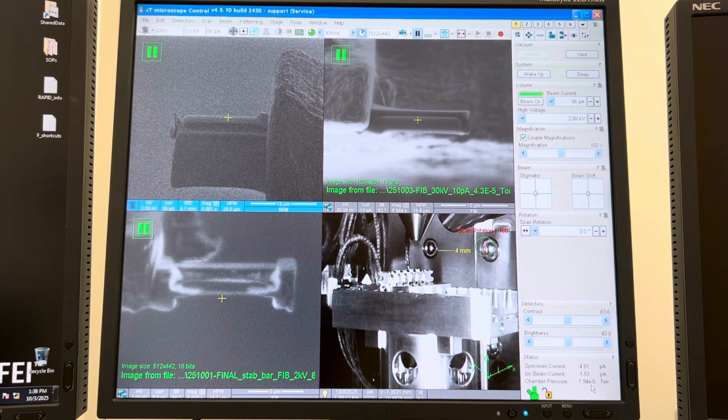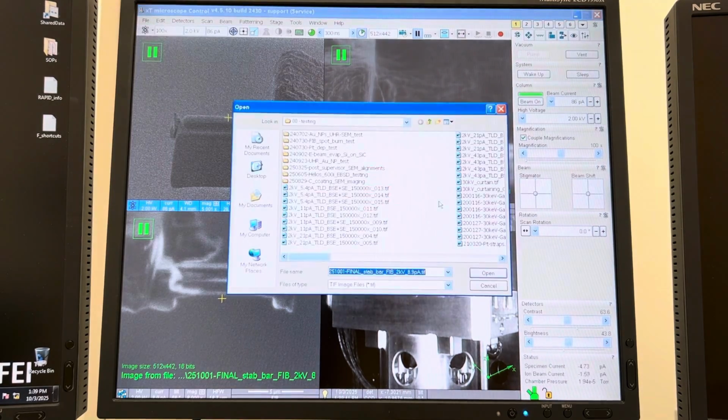When the vacuum is in the -5 torr range, this is not going to appreciably impact the SEM, okay? Those electrons are moving way too fast for that to be an issue, but it's not the same with the FIB, okay? So I actually took a very good image with the SEM right after I got the chamber vacuum back. This was, I think, mid -5 torr when I took this. Well, actually, here, I can show you this. So I took this image here.